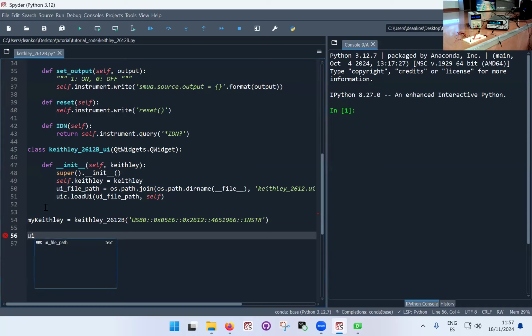So I'm going to generate a variable. It's called the user interface app, and this is a Qt widgets QApplication. So I'm going to put things that you just should not worry about.